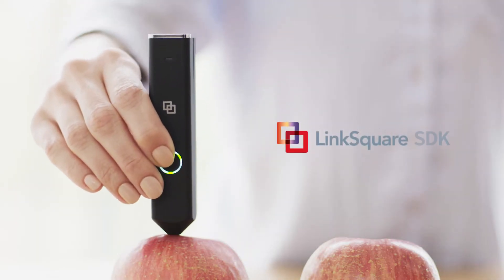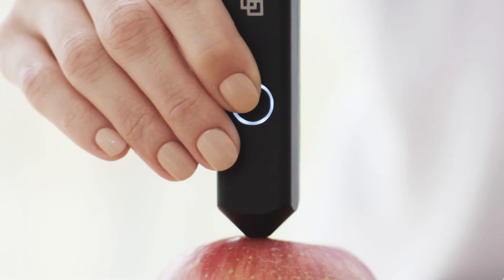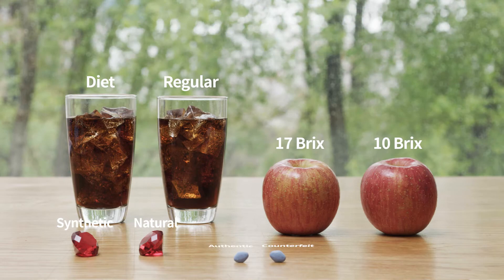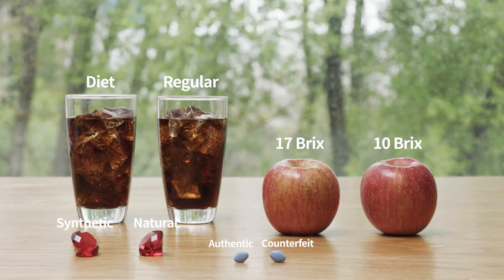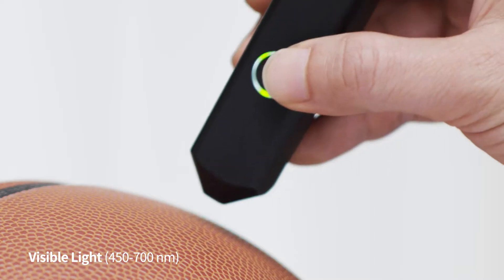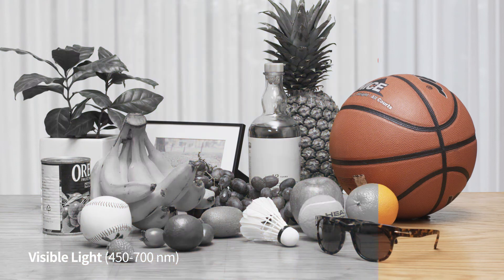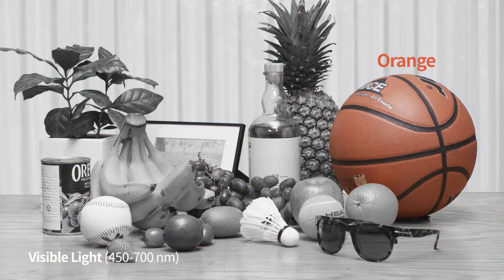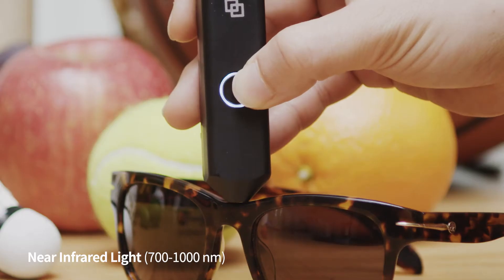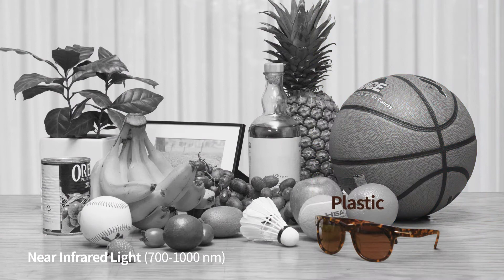Introducing LinkSquare SDK, a portable spectrometer and development kit. LinkSquare uses visible light to determine the exact colors of objects, and it uses near-infrared light to detect their molecular makeup.